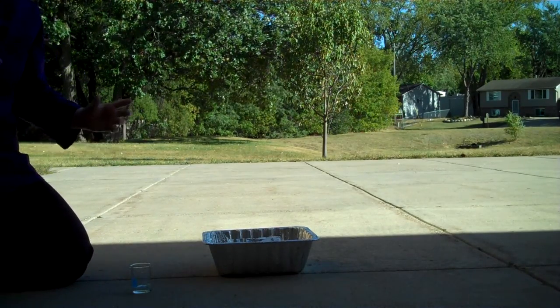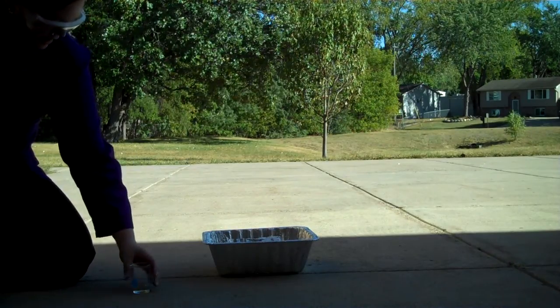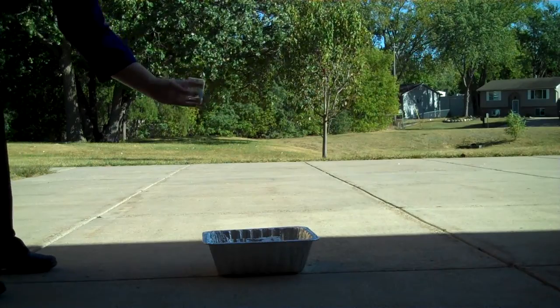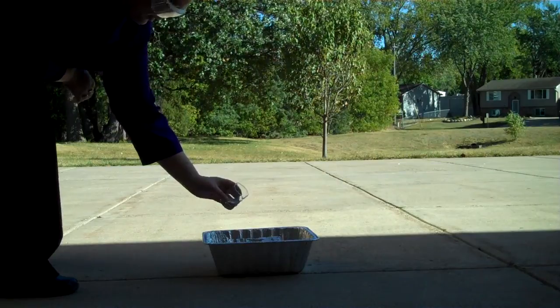I have my lab coat, I've got my goggles, I've got my safety shoes on, my closed-toed shoes. Stand up a little bit so I can get back, and here comes the sulfuric acid. One, two, three.